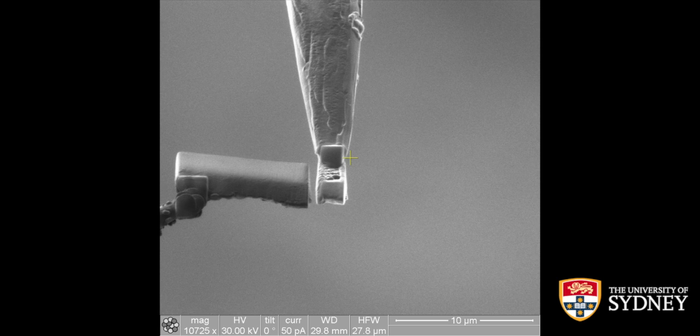In this case, the weld is actually a weld that I would use directly, so there's no further welding involved that I do in an optimized geometry where I've got better gas flow or better precursors or whatever. I know roughly that these welds in these settings that I do here, which is 10 picoamps and this sort of GIS geometry, will fracture somewhere between 7 and 8.5 kV in the atom probe, which does the job decently well.